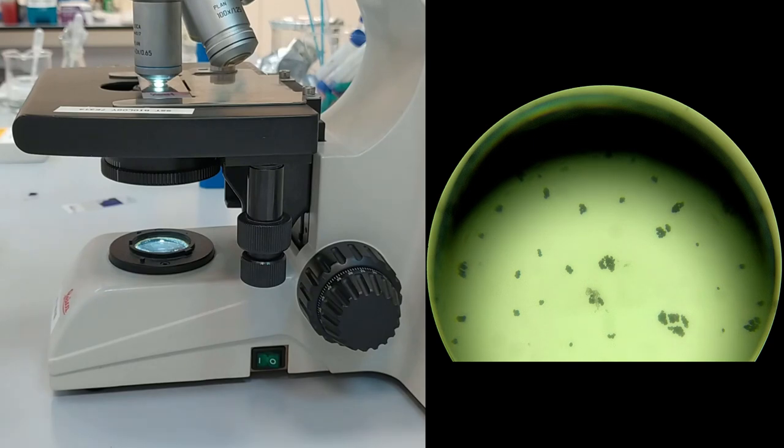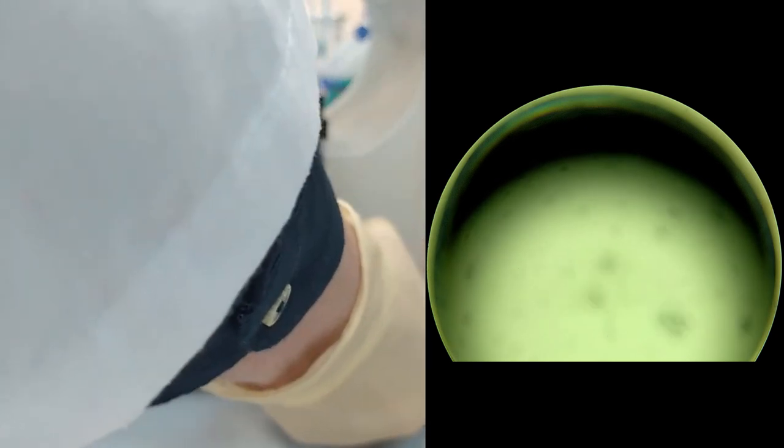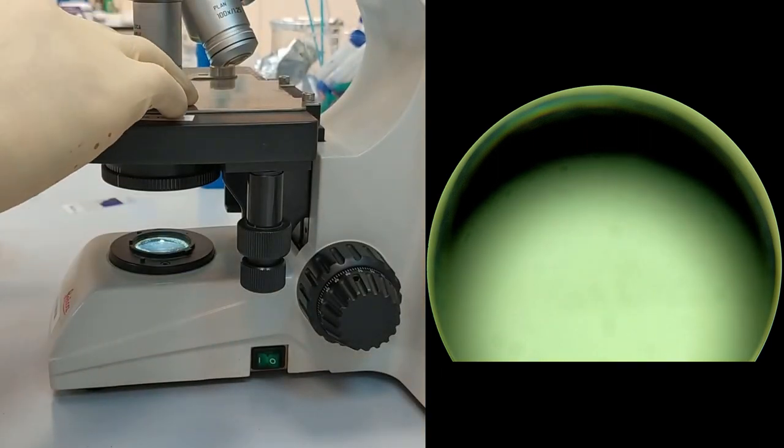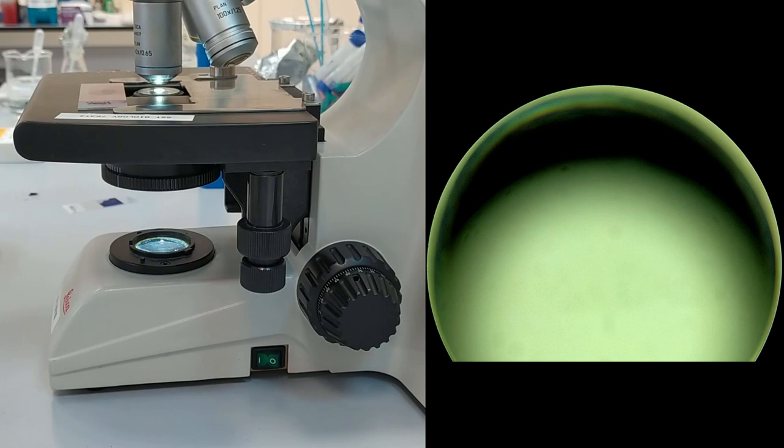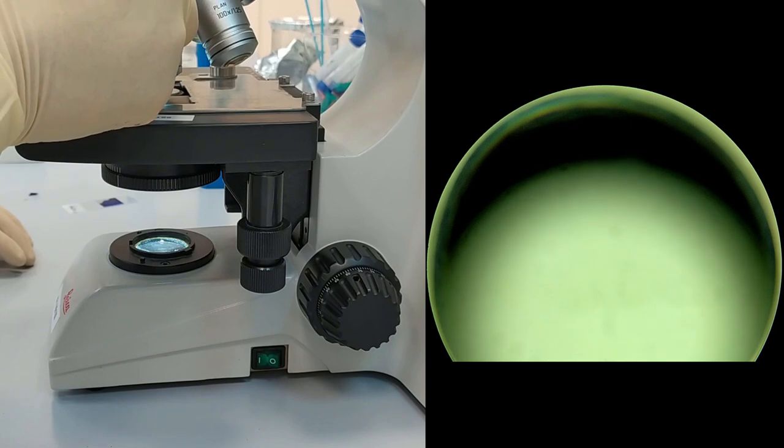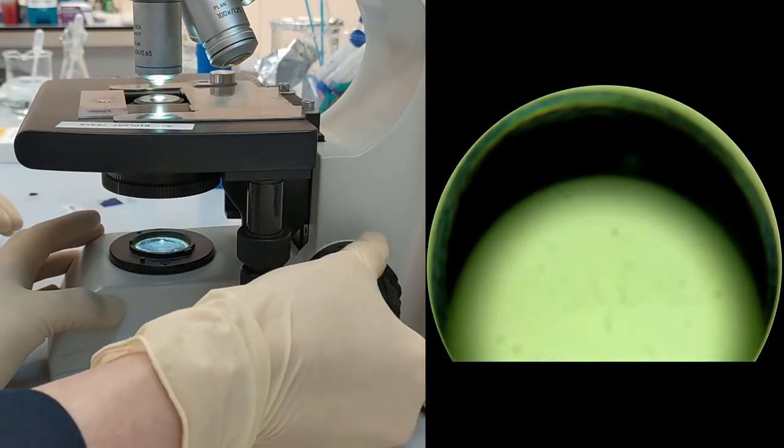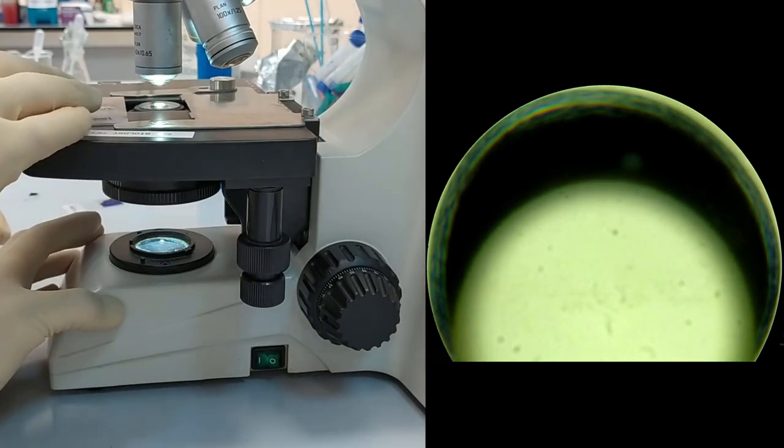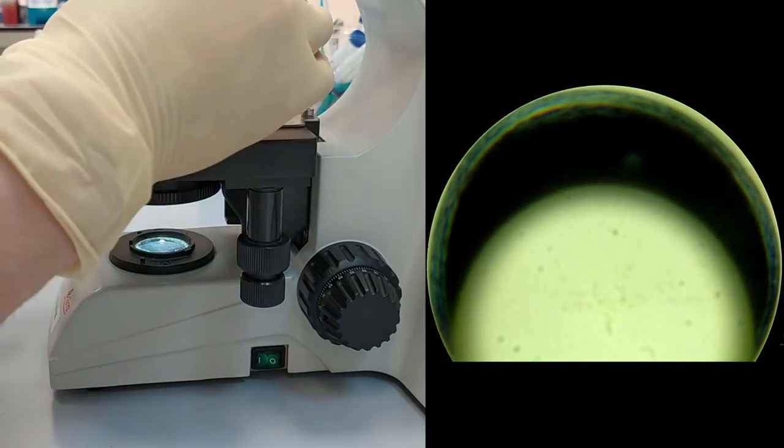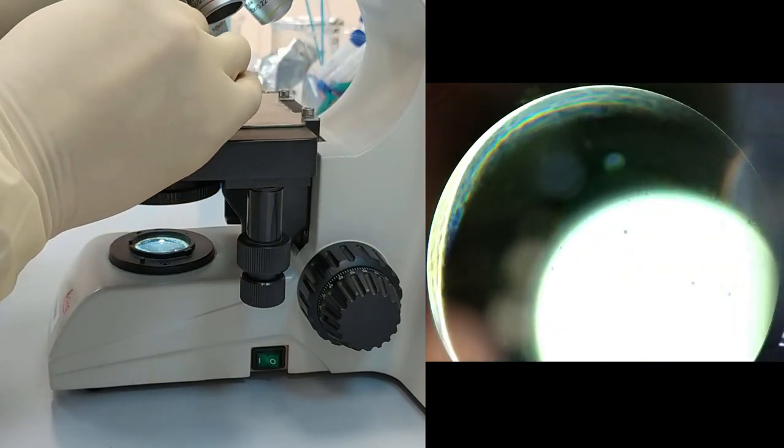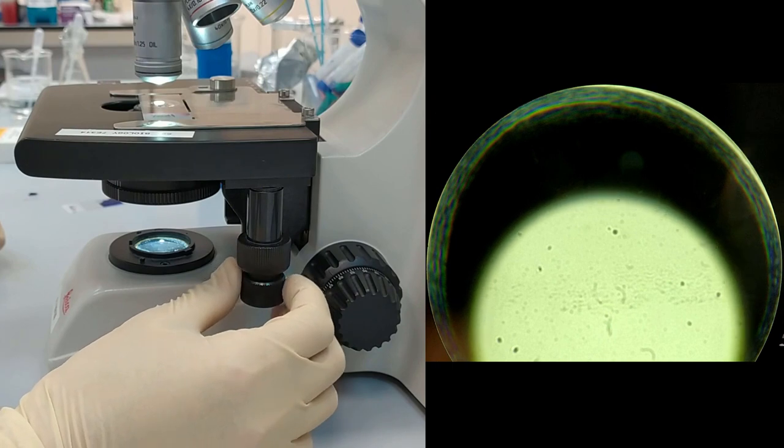Now we are going to drop an oil on the slide so that we can use the 100x. We lower the stage to the maximum, place our sample, and then change the objective to our 100x.